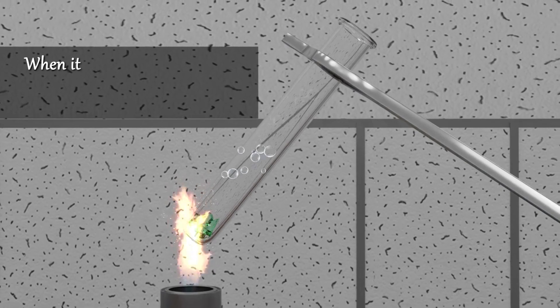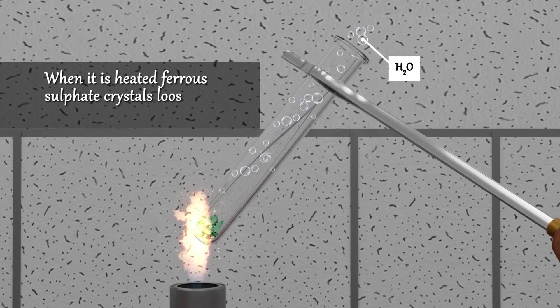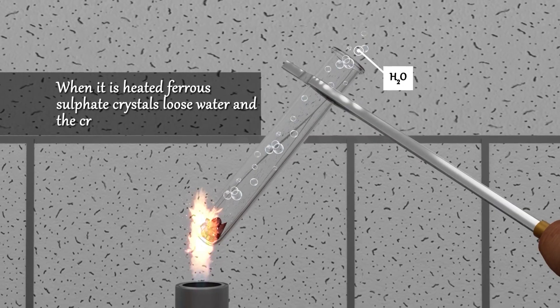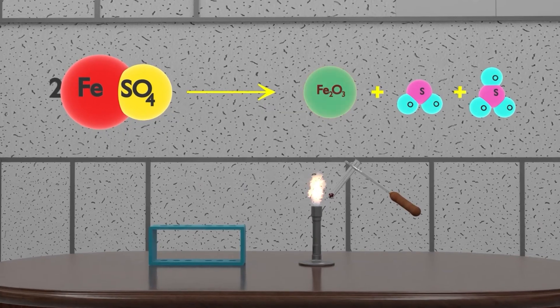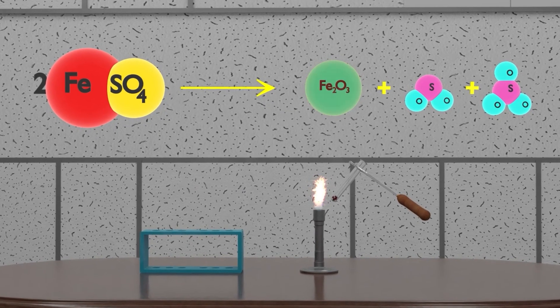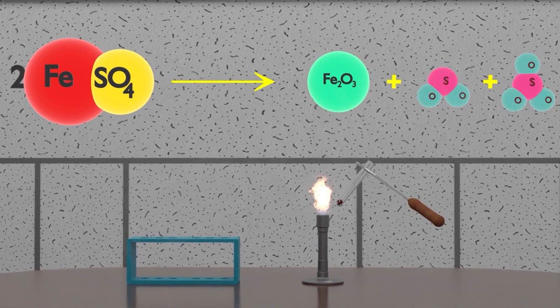When it is heated, ferrous sulphate crystals lose water and the color of the crystal changes. Ferric oxide is solid, while SO2 and SO3 are gases.